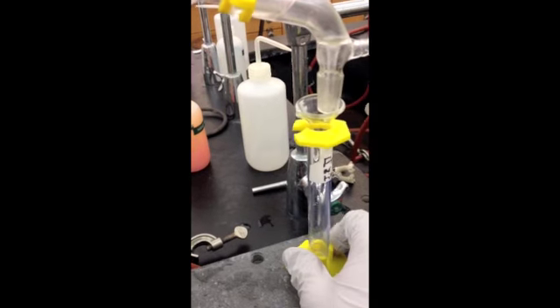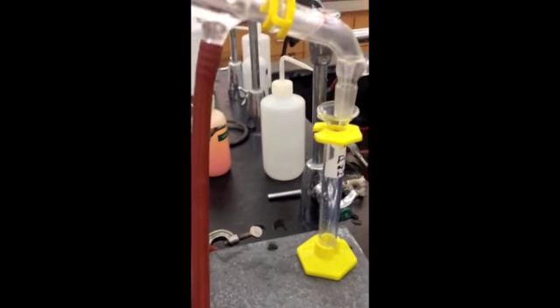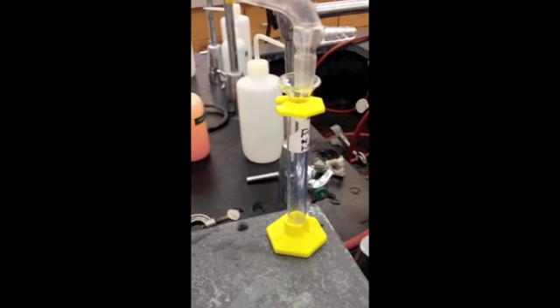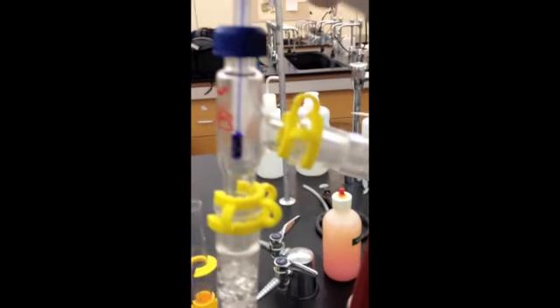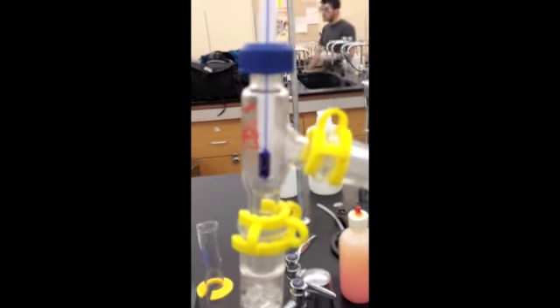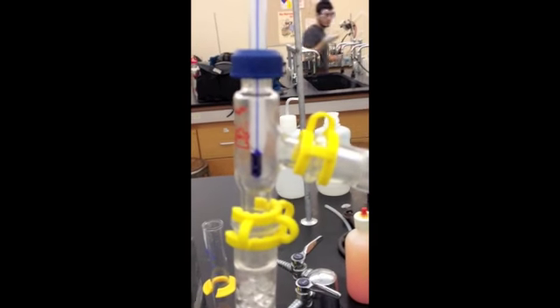In your graduated cylinder, when it reaches one milliliter of distillate or 0.5 milliliters of distillate, look at the thermometer and mark the temperature at which your distillate is at. If you've set up the thermometer correctly, then your temperature should be around the range of the boiling point of the first fraction, depending on what it is you are distilling.